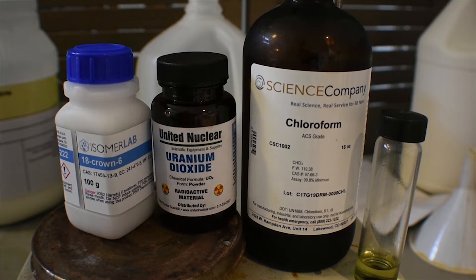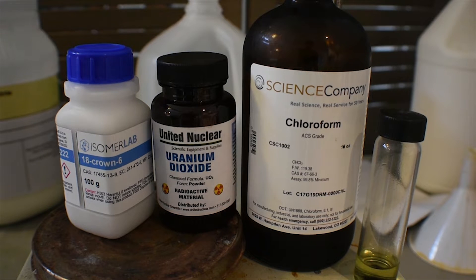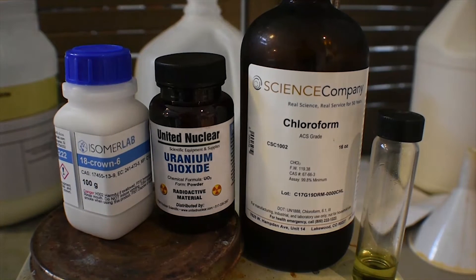If complexation did not occur, the chloroform layer would basically stay colorless and no green color would be observed. However, after conducting this experiment already, I know that it works, so let's get on with it.